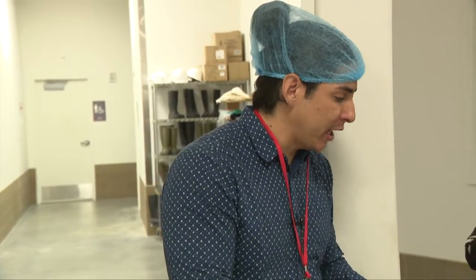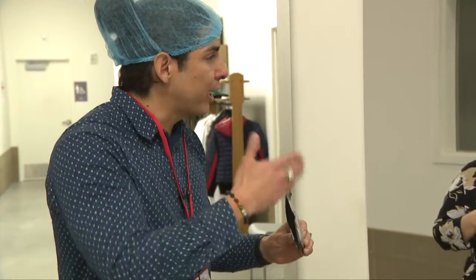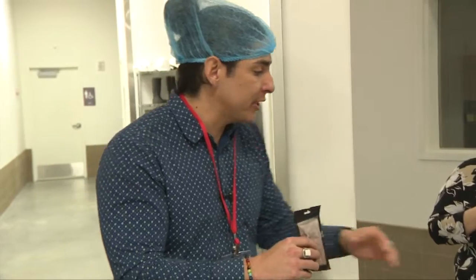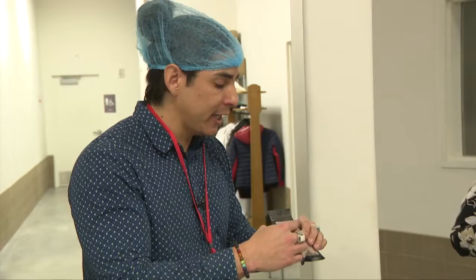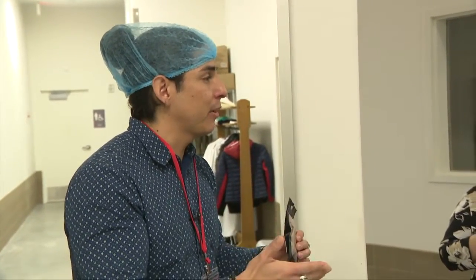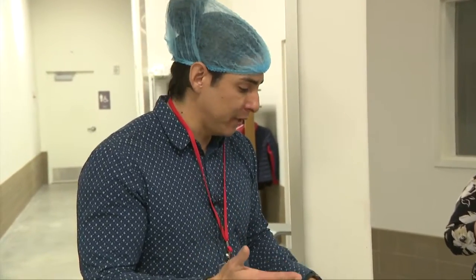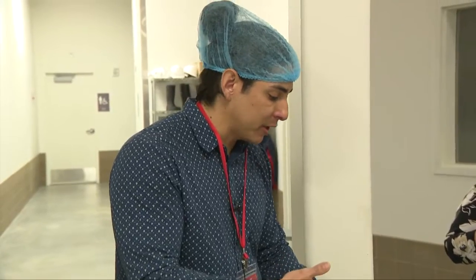When it comes to putting a sample in this device, if I was going to prep the sample, I'd just want to cut it up and expose the inside. This allows it to come to equilibrium faster and ensures an accurate reading. You don't want to grind it up into a powdered form, because any time you introduce heat, it's automatically going to change the moisture and the water activity. We want a water activity reading that's representative of the final product itself.